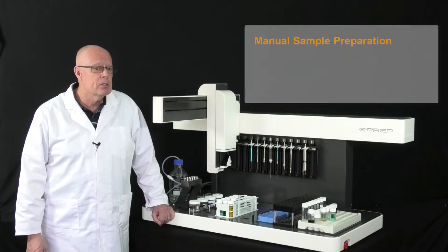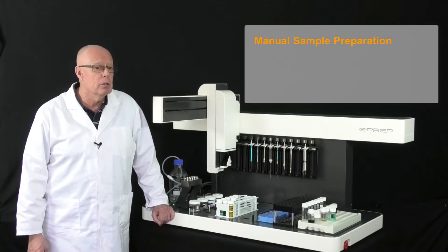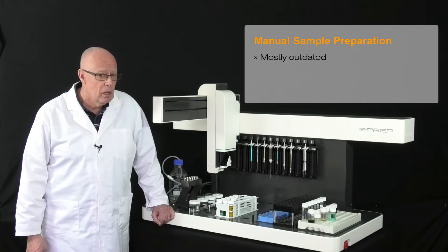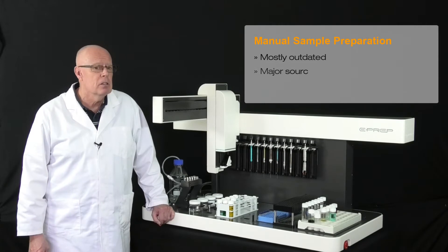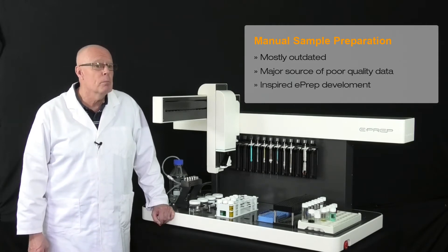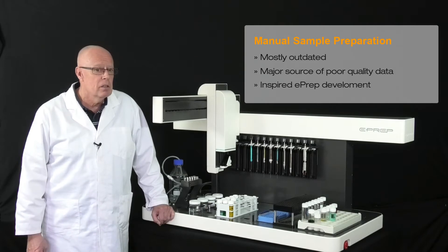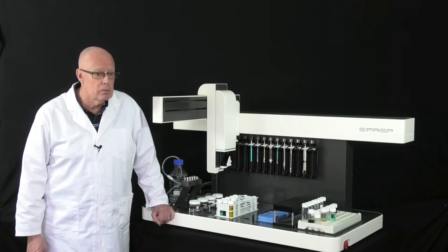E-PREP development came about through recognition that in most labs, standard and sample preparation hasn't kept pace with instrumental and software development. And because of this, the same manual sample preparation techniques that have been used for over 30 years are still the major source of poor quality data. So E-PREP, the company, decided to do something about this.